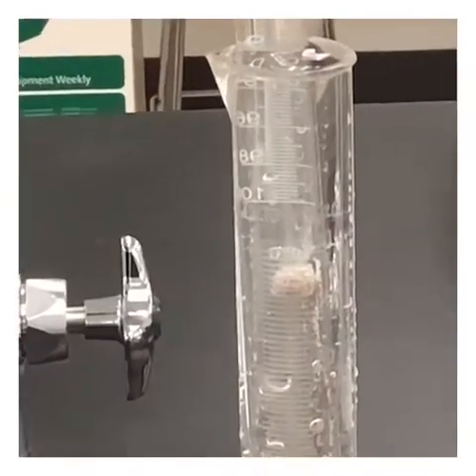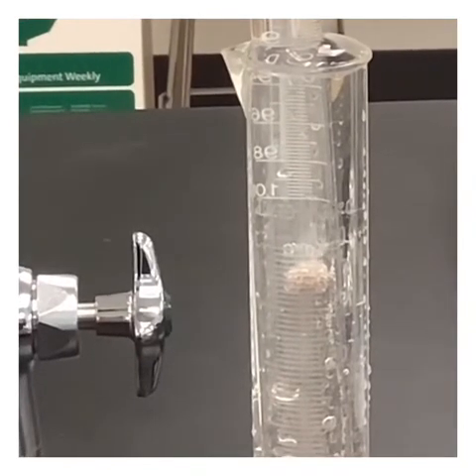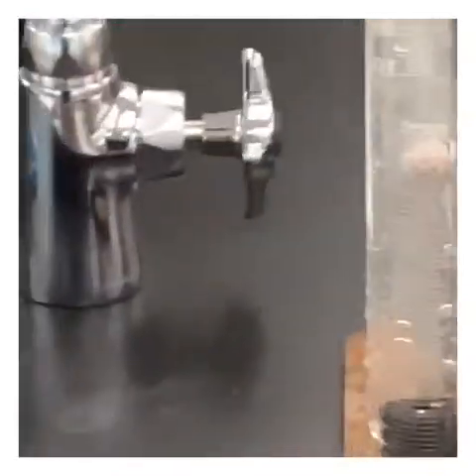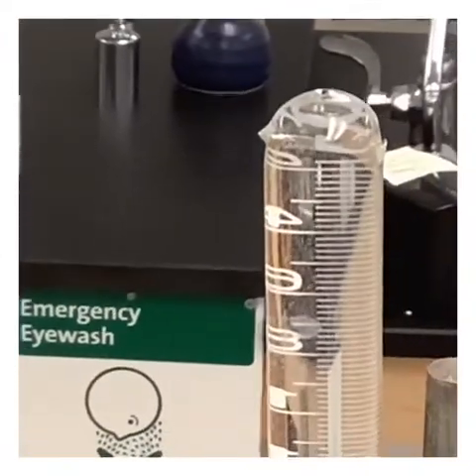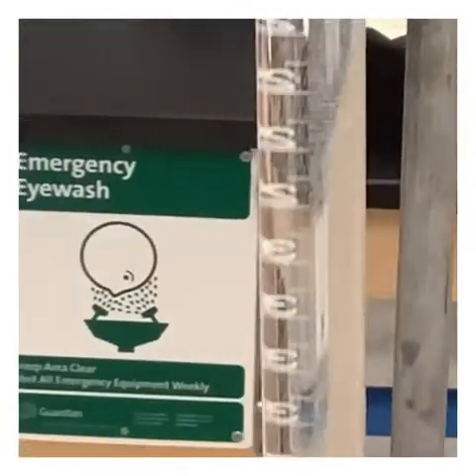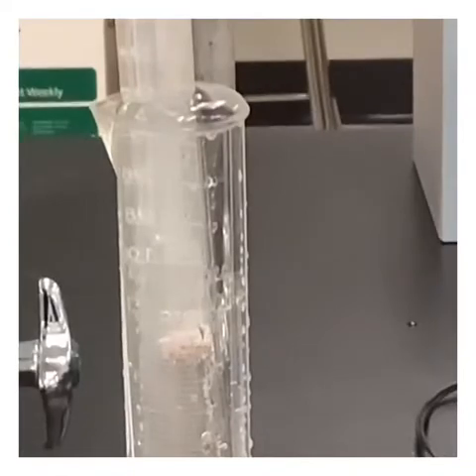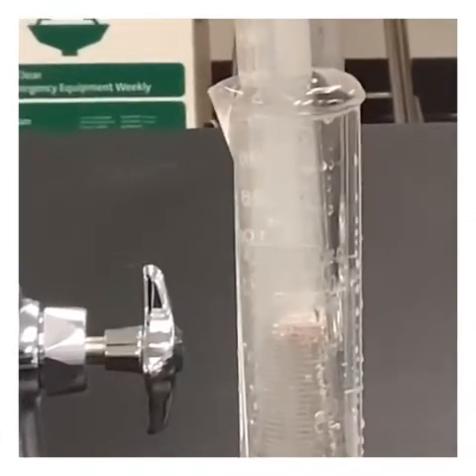Okay, so we're starting to see it fizz a little bit more now. What we want to do is just keep watching this thing, and we need to let this go until it's done fizzing, until it's done reacting. If we move this up to the top, you'll see that we're starting to get a little bubble that's collecting there. We're going to let this thing keep going for a while. We're starting to see more and more bubbles form as more and more acid reaches that magnesium sitting at the bottom. So we just have to be patient and let this thing react.